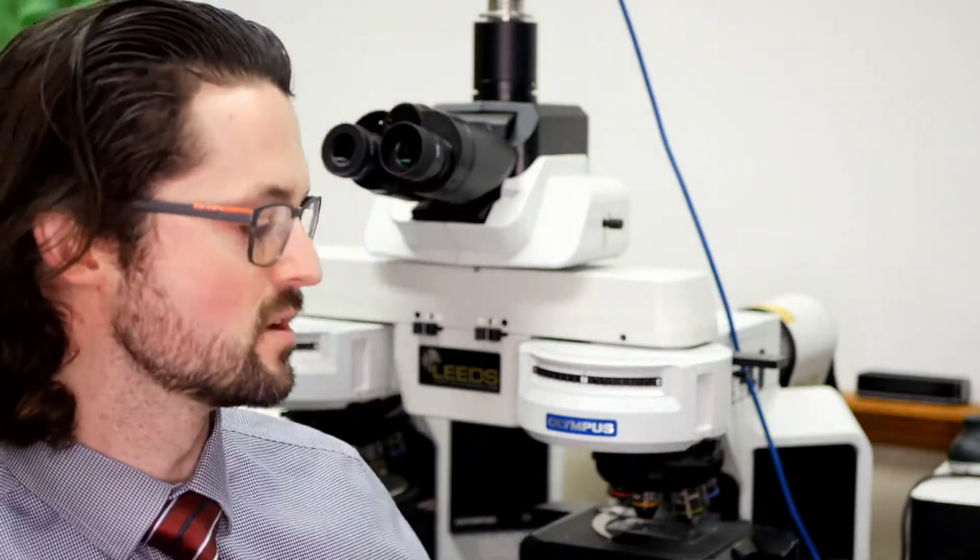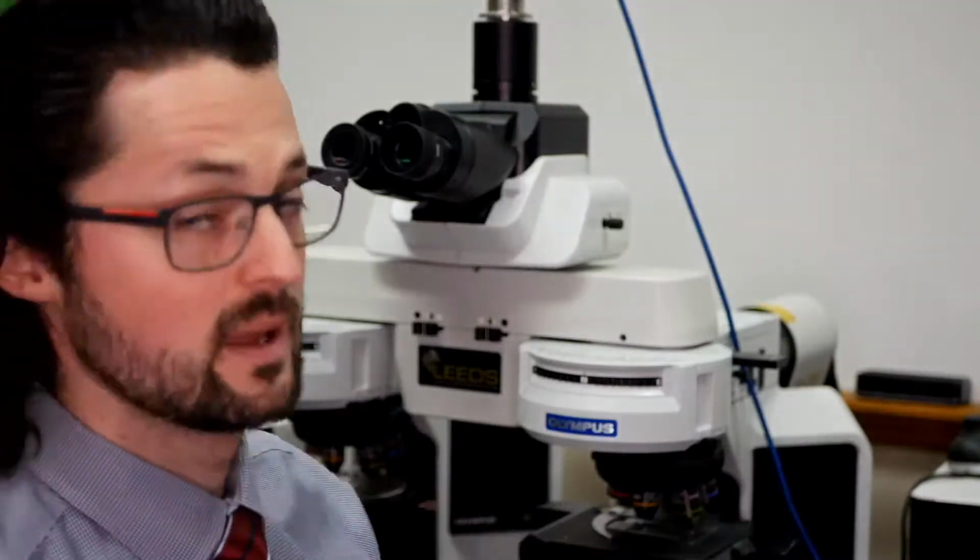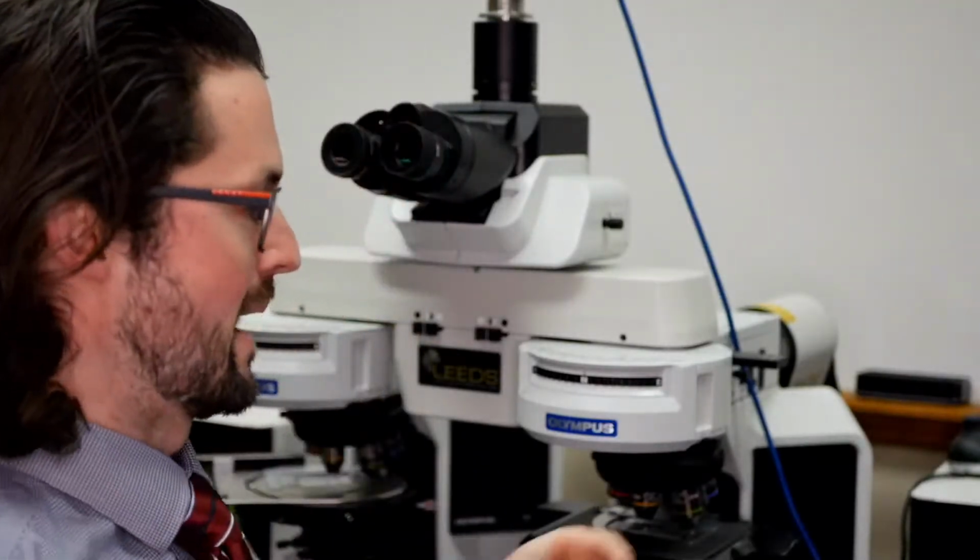In the past, before LEDs became really big, more on that in a moment, what we most often sold for that single light source is something similar to this. This isn't exactly the model that we would sell, but this is a halogen light source. Halogen light sources are really just a light bulb, essentially. It's not an LED, it's a light bulb. As we turn it on, there's a little rheostat, and you can adjust the intensity of that light. Now, the downside of halogen light sources, while they're really bright and really powerful, is they generate a lot of heat, and they go through bulb replacements.